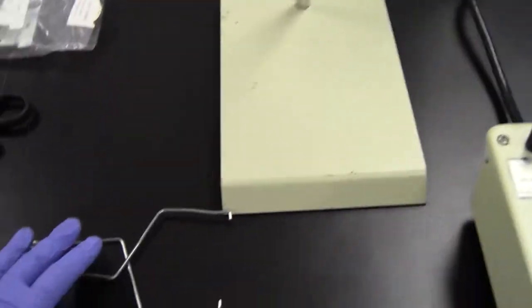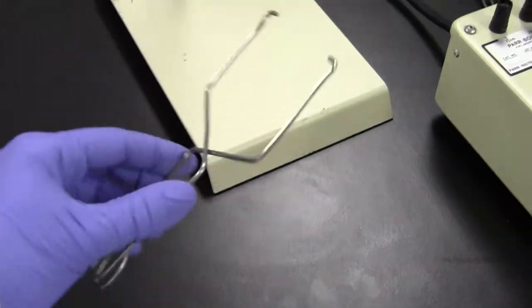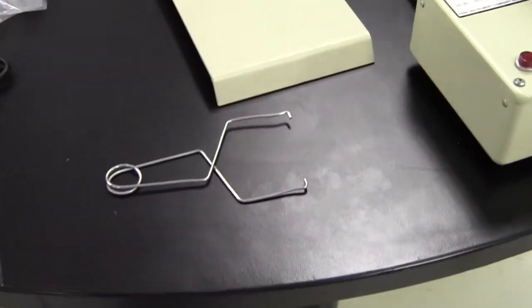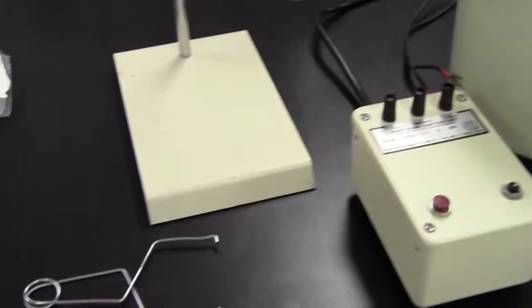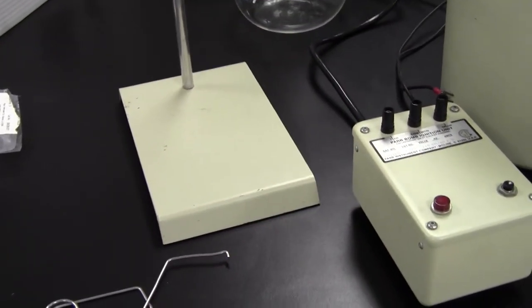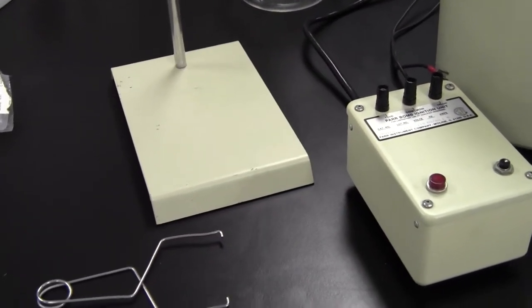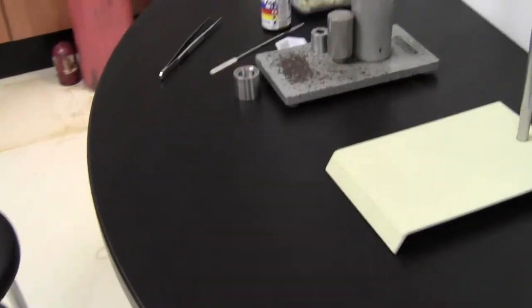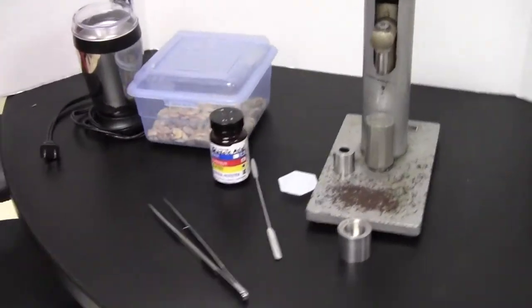Lift out the bomb, but you can reach in and get it with your hands now because you're not worried about the water spilling. Take the bomb out, and when you take the bomb out, you're going to open that pressure release valve very carefully and let the gases exhaust, and then come back over to our sample preparation table after everything is cleaned.